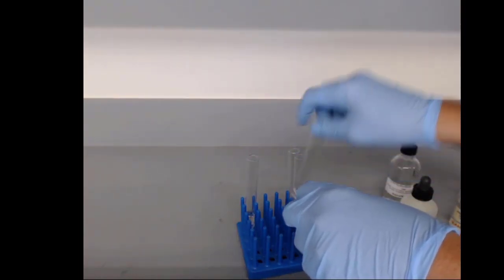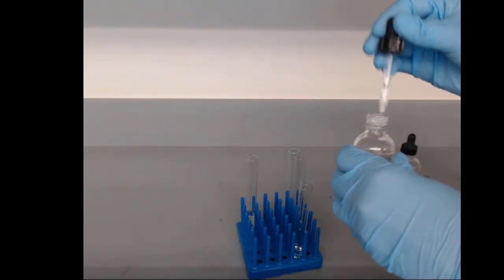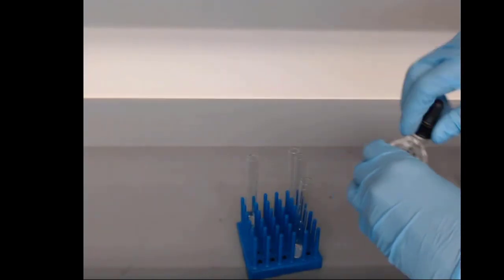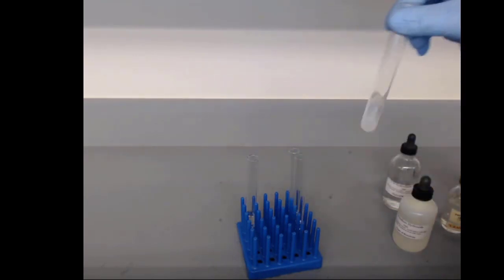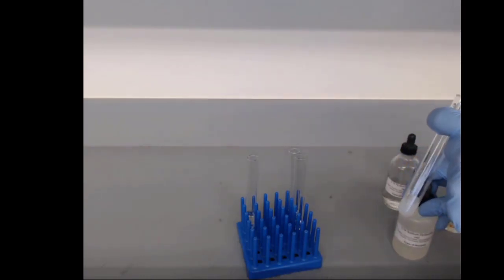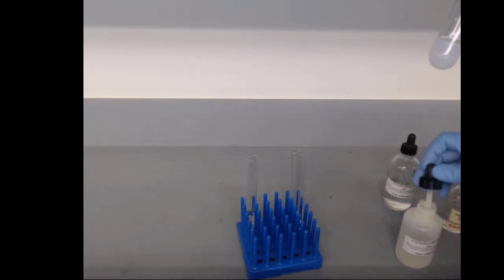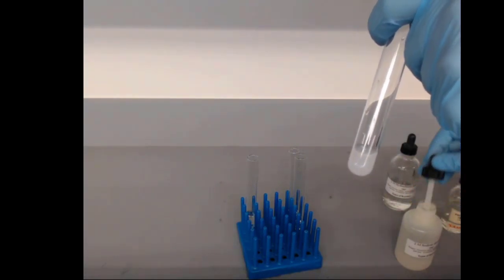Now, phenolphthalein in our acidic conditions, just a few drops. Oh, I might have put too much. Weird. It's not supposed to be cloudy like that. My guess is there was some contamination in there. I should have cleaned these first.